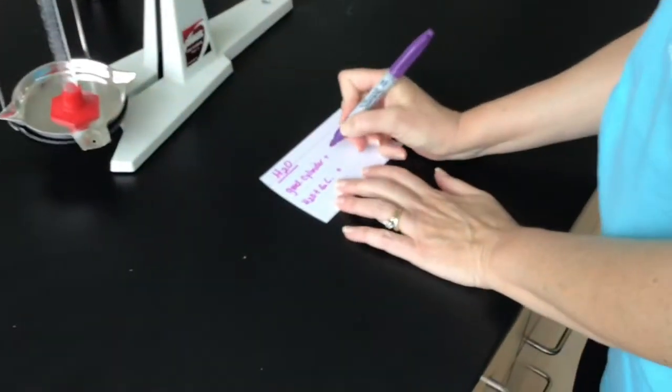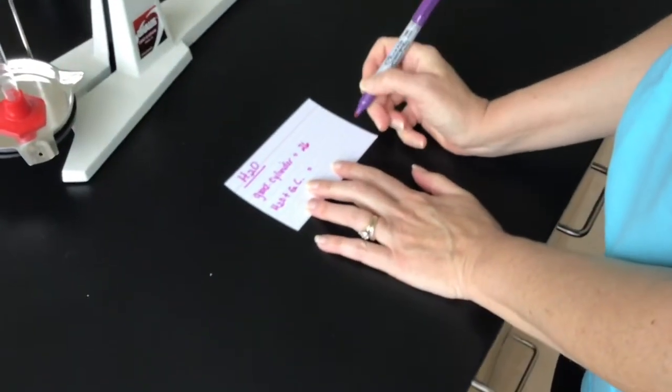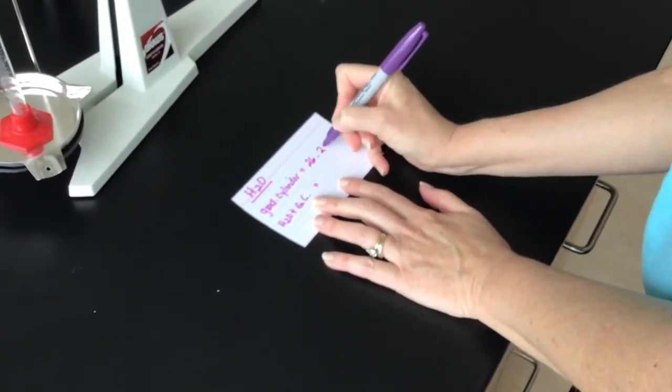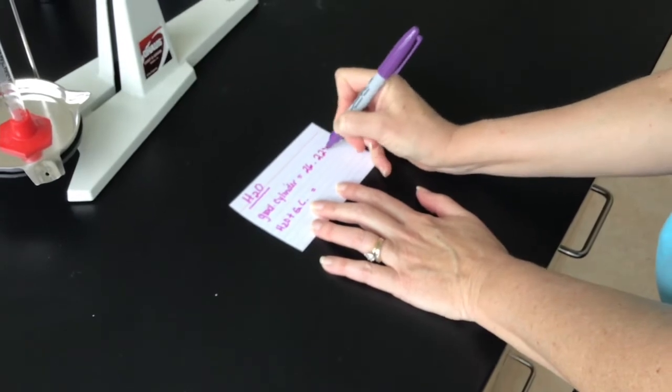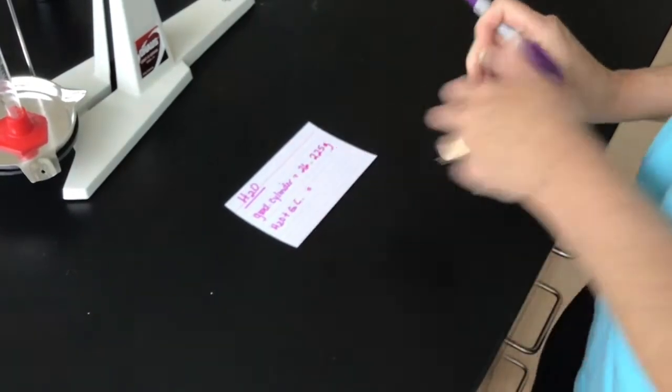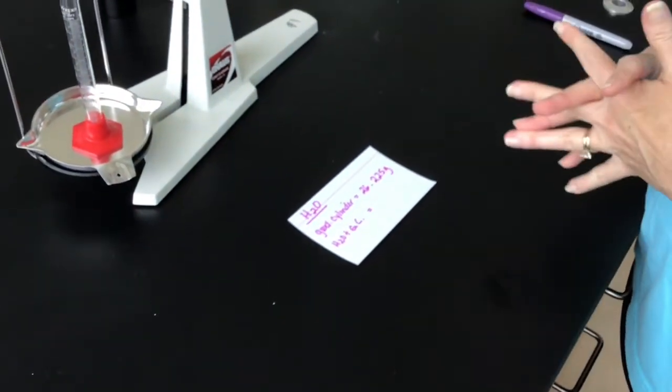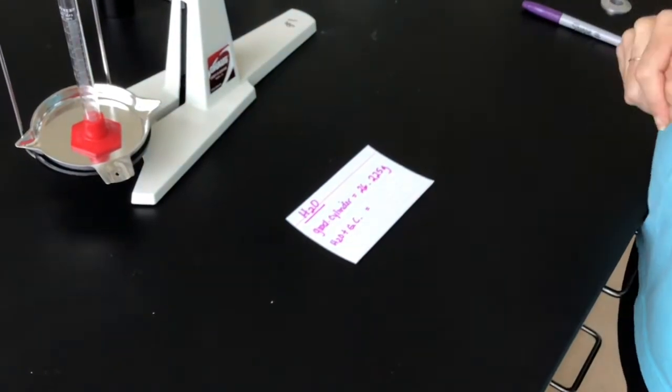So the graduated cylinder that we're using is 26.225. And I am going to reuse the same graduated cylinder for each of these because I can rinse the liquids out pretty well. So this will be our mass of this graduated cylinder for all of them except glycerol, because glycerol I've already prepared.